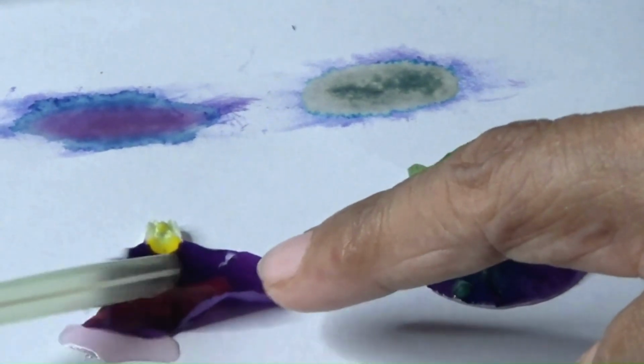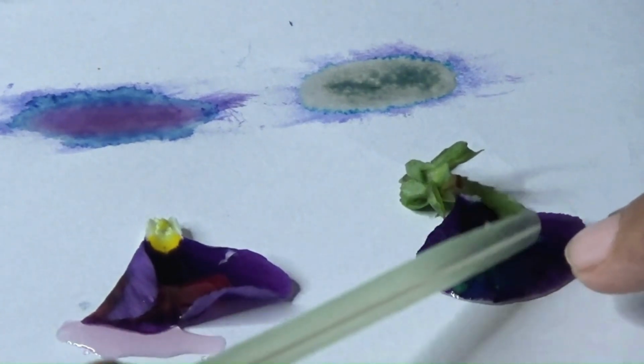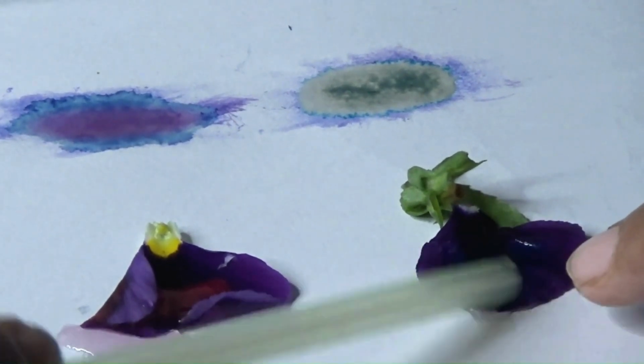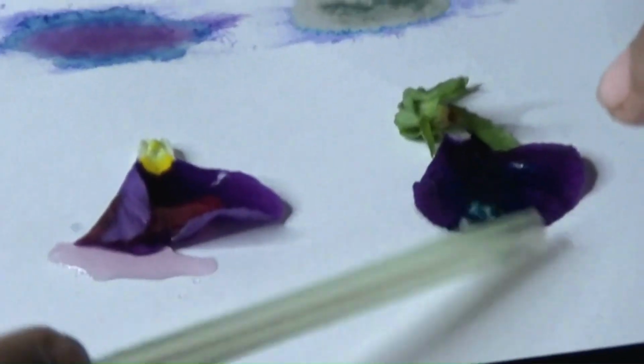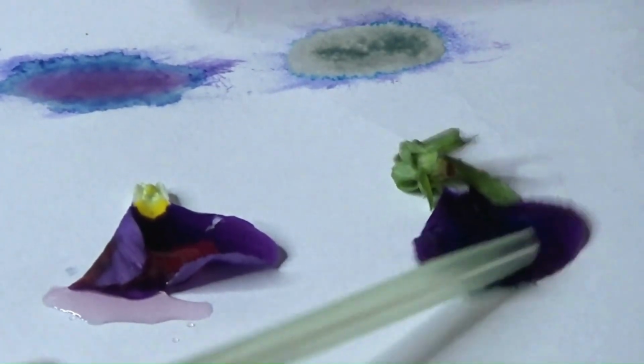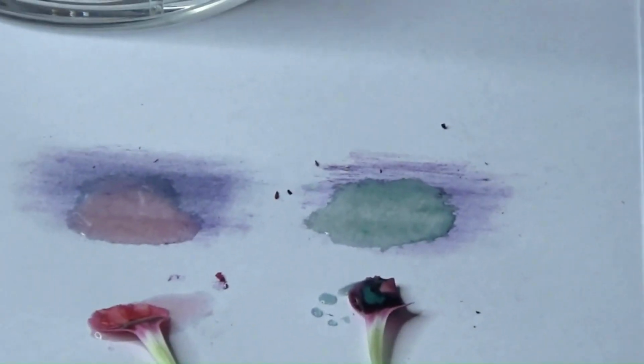And here the blue flower or the purple flower has become very much red with acid, whereas the base has turned it into blue-green. So flowers have shown a very good capacity to act as indicators. Other colors of flowers also show some indicator property, as we saw here.